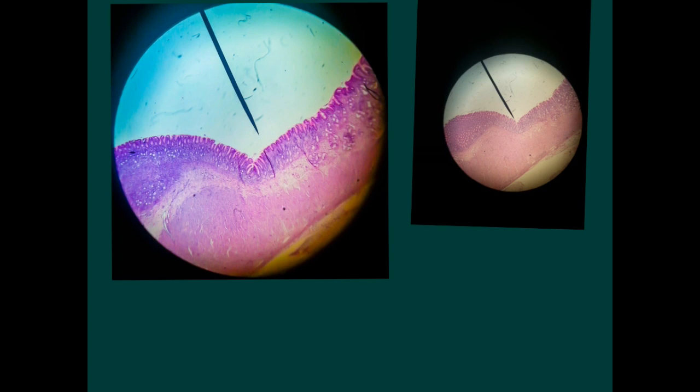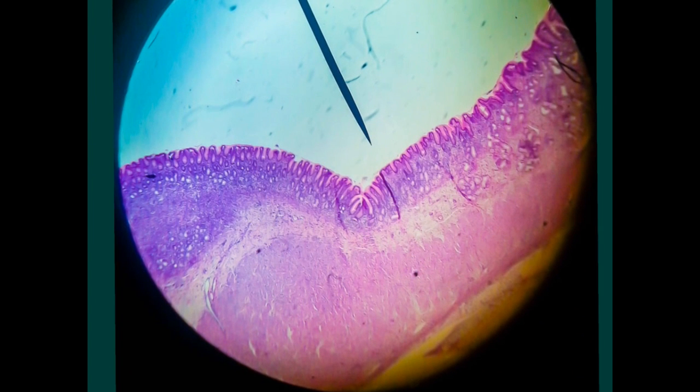In case of the pyloroduodenal junction, the condition is different. You will search the whole epithelium, and you will notice that all through the epithelium you have these white striations denoting the ducts of the glands, and on the other side it is the same. This second muscle represents the area of the pylorus, and this is the area of the duodenum where you can see the Brunner's glands. So all through I have these openings, these ducts.